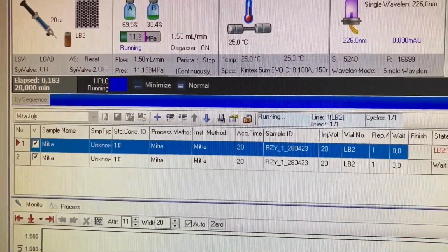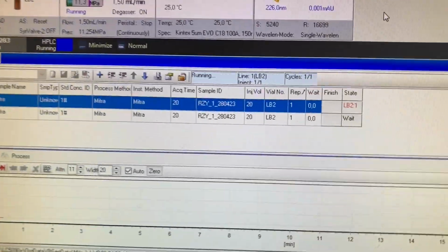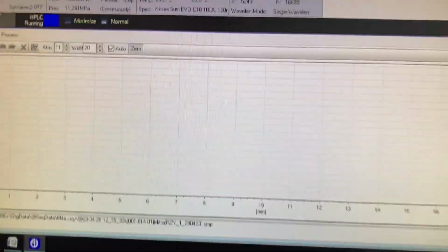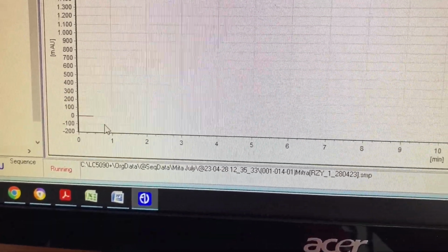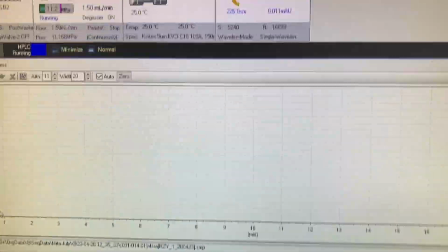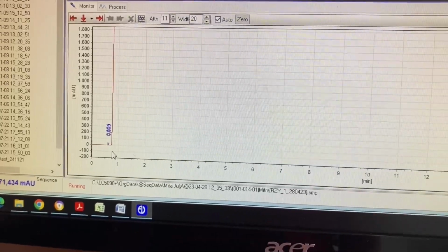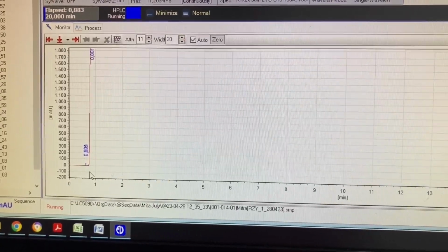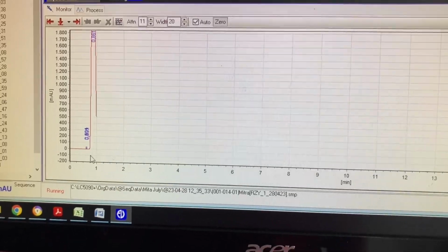Right, now, as you can see, the pressure is increasing over time. I'll get rid of that sequence by pushing that, and just watch the graph. It's nice and stable, that's what it should be doing. Nice and straight, everything's looking pretty good. It's very normal for it to have a couple of peaks right in the beginning. Everything's normal so far.